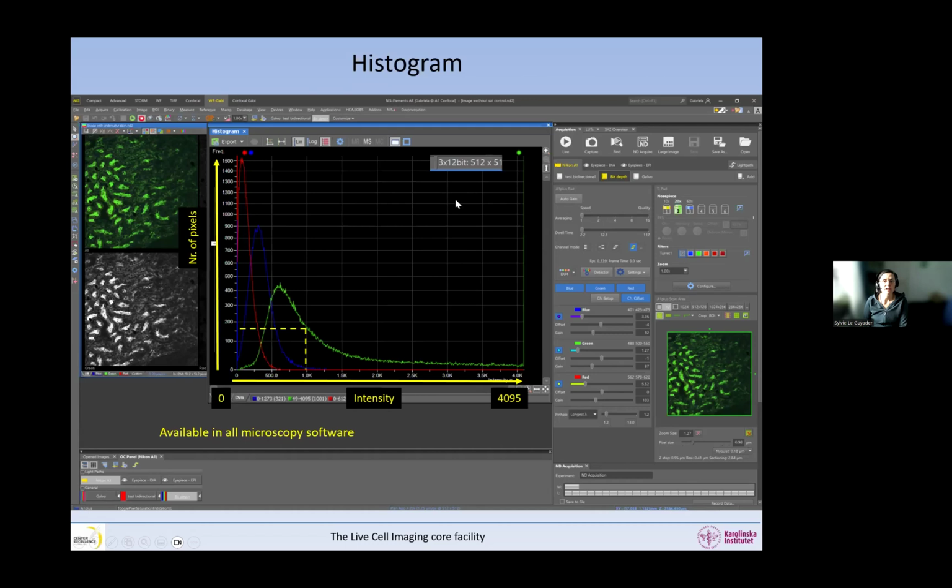So this image is in bit depth, in 12 bits. And so the minimum is 0 and the maximum is 4095. So this we know now. And so when I look in Nikon software, I can put my mouse here and see the distribution of all the pixels that have the intensity 0. I can see that a lot of pixels have the intensity 0 in the red and in the blue channel, but nothing in the green channel. So I have underexposure in the blue and the red channel.